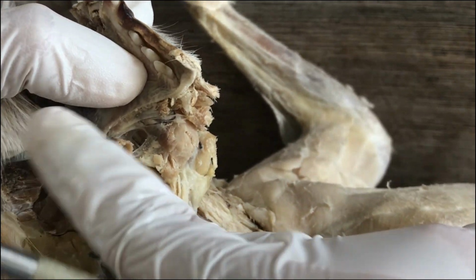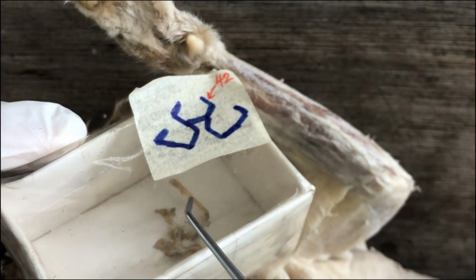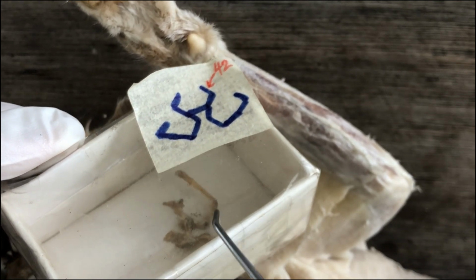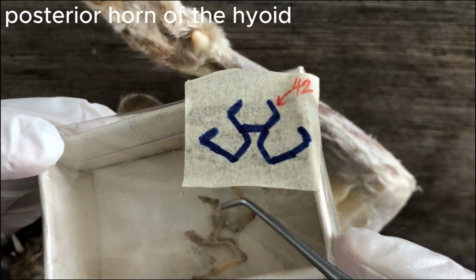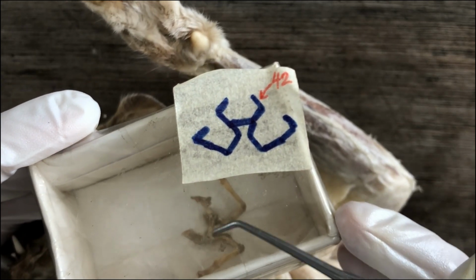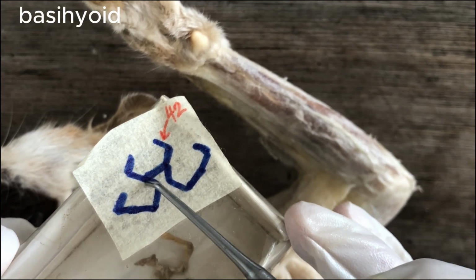When you opened the jaw, one side of the jaw, essentially you've also cut that and one of the anterior horns of the hyoid bone. That long horn there is the anterior horn, and then the shorter horns there are the posterior horns. And that horizontal bone there, as indicated in this diagram, is the body of the hyoid, or basihyoid.